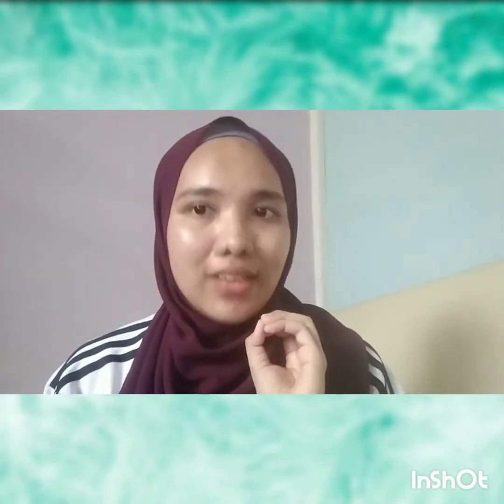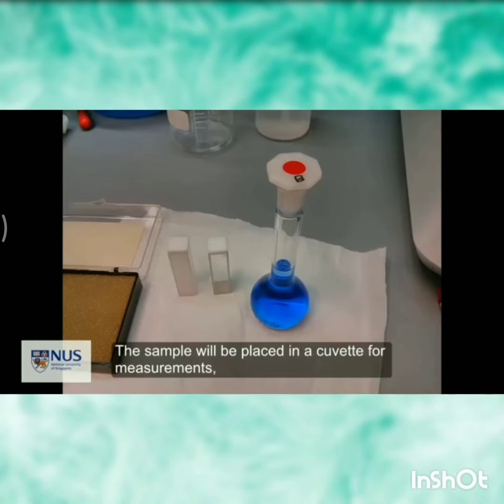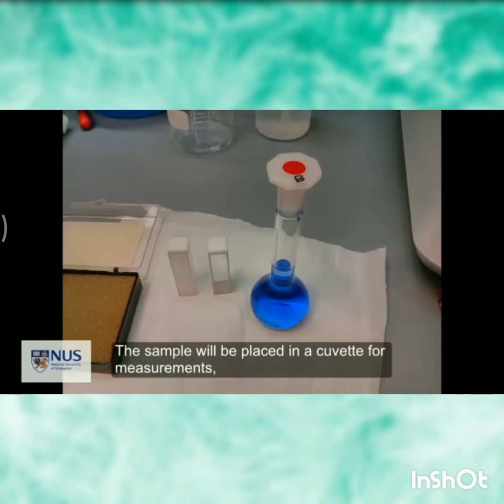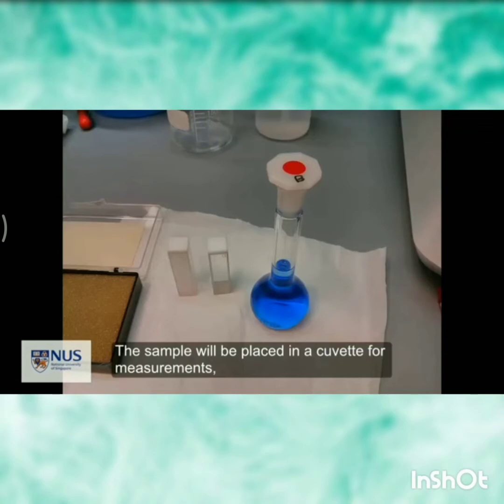First of all, we need to prepare the standard solutions from 5 ml until 25 ml. To prepare the standard solution, we must pour a soft drink into a beaker and stir to remove the carbonation. Then, we pipette 5 ml of the soft drink into a 50 ml volumetric flask and dilute to the mark with distilled water. Cover and shake to make a homogeneous solution. Store in a small beaker. Then, repeat the steps using 10 ml, 15 ml, 20 ml and 25 ml of soft drink.